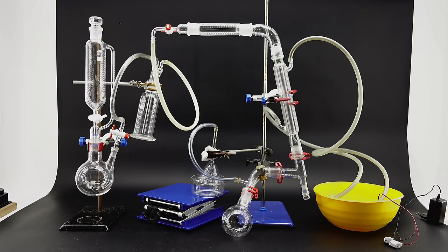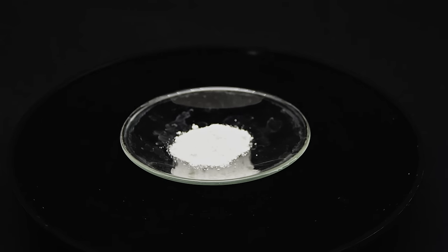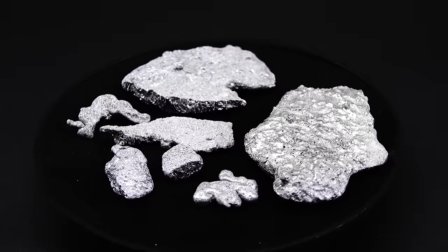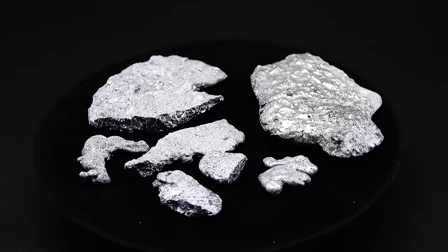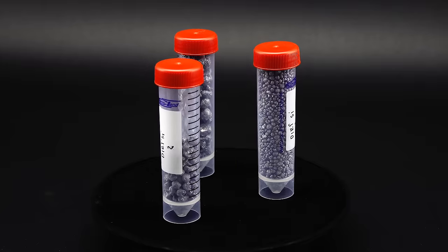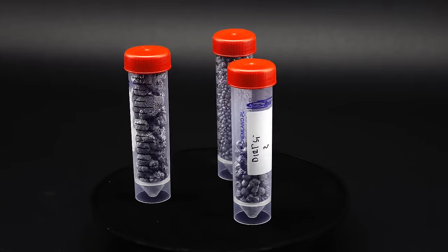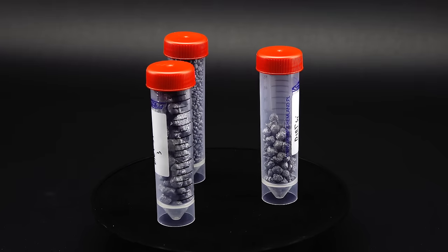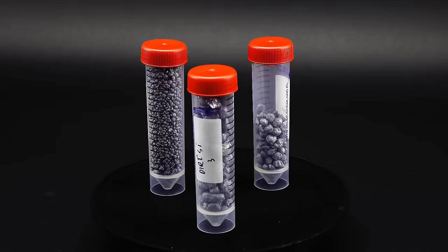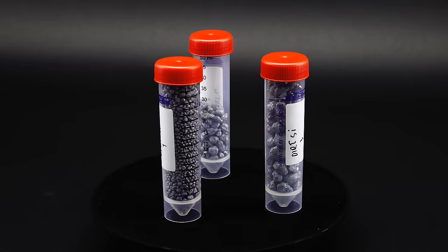Anyway, before starting to assemble an absolute unit of an apparatus I wanted to first weigh out and prepare all the ingredients and since there are only three of them this time it shouldn't be that hard. First up, I of course have my homemade silicon blobs of various sizes. I originally wanted to use most of them since I made them on such a big scale but after running some calculations on the required amount of the other ingredient I suffered a math-induced heart attack and settled on a 1 mol scale or 28 grams.